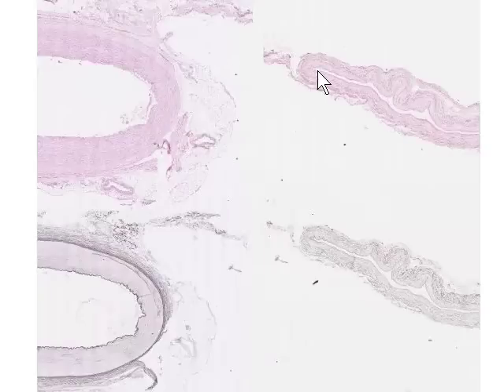We can see that the vein, having a much thinner wall, has collapsed, and if this were expanded out, we'd see that the vein would actually have a larger lumen than the artery does and a considerably thinner wall. At this magnification it's difficult to make out what the wall structure of the vein is. It has a tunica intima on the luminal surface, a thin disorganized tunica media, and the bulk of the wall of the vein is made up of tunica adventitia.